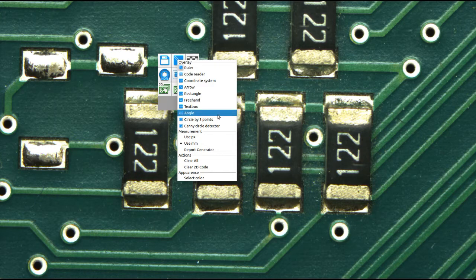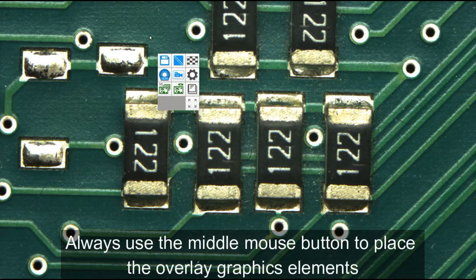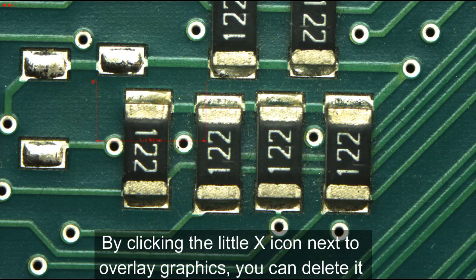Select an Overlay Graphics element and click your middle mouse button to place it on the image. You can delete each element by clicking on the X next to it.